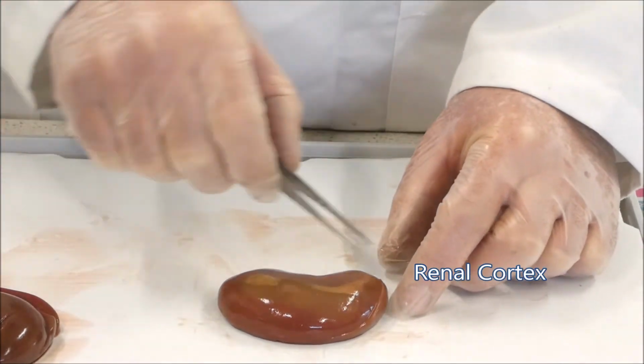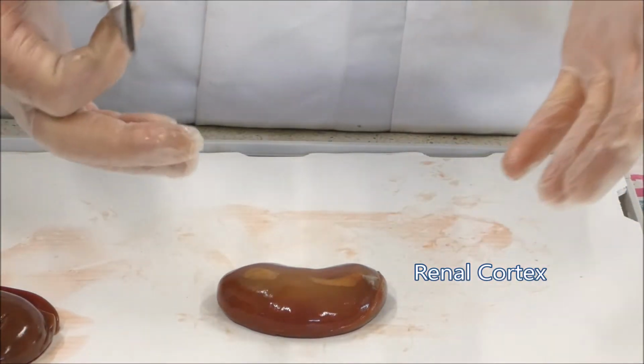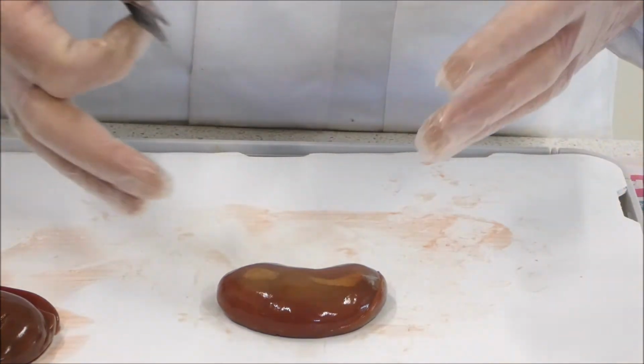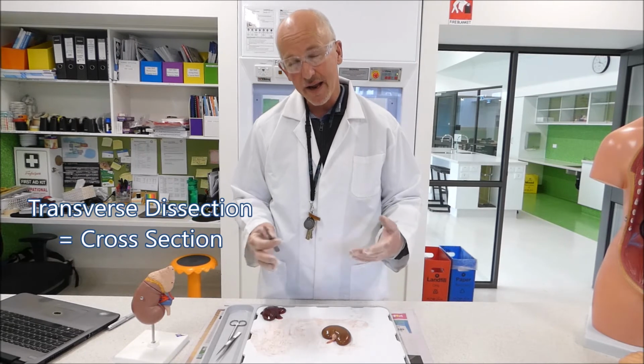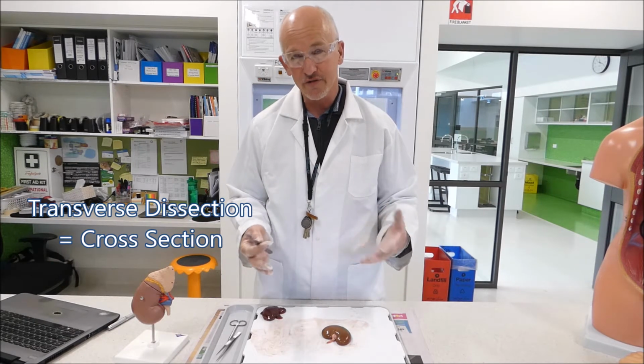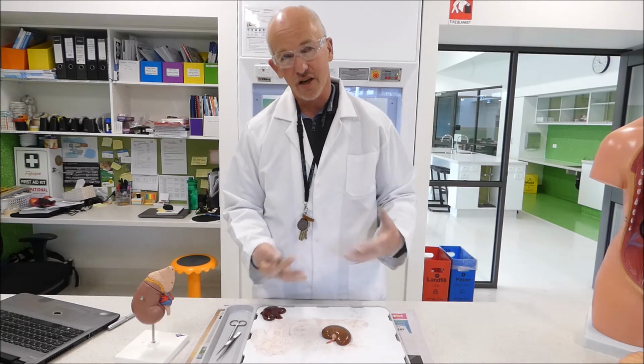The outside layer of the kidney is called the renal cortex. We'll talk a little bit more about the renal cortex and what structures it contains once we get inside the kidney. Okay, so what we're going to do with the kidney today is a transverse dissection, and transverse means a cross section. So we're going to go across the kidney to show the internal structures.